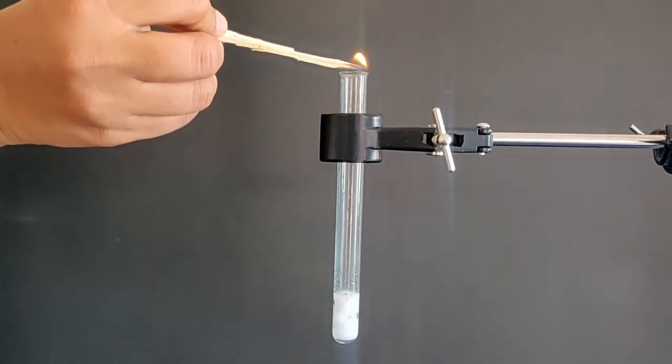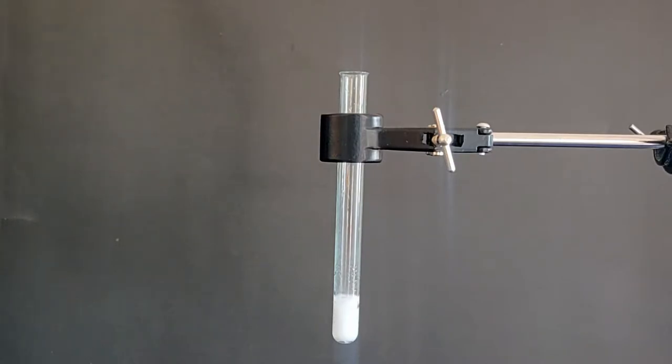To check the gas released in this reaction, bring a burning ice cream stick to the mouth of the test tube.